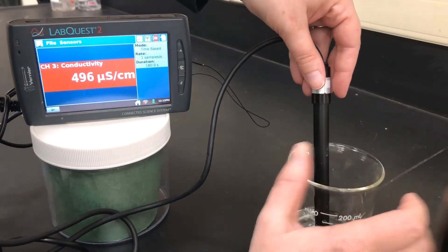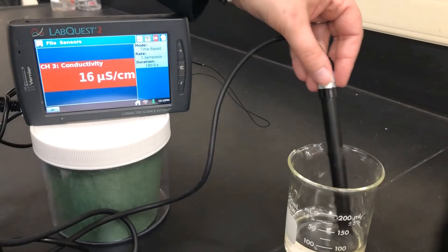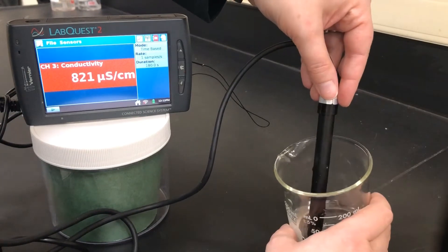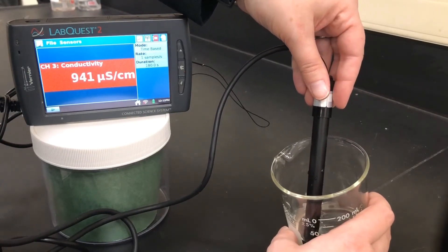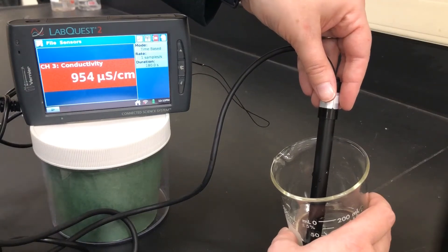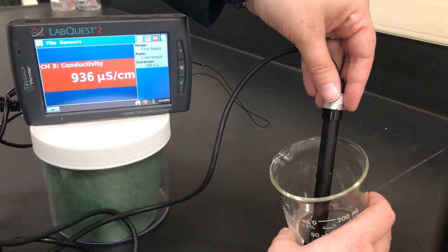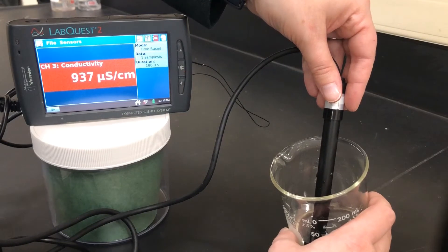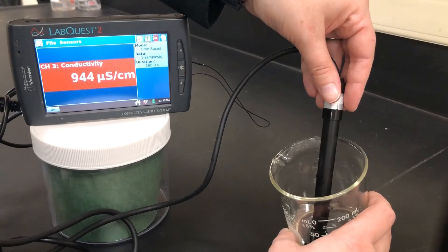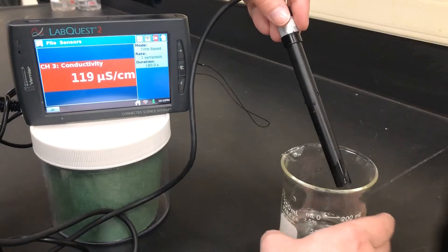Let's proceed with our second drop of iron 3 chloride. Second drop — give that a stir and a swirl, then hold it steady and let's see what the number is. 944 for our second drop of iron 3 chloride.